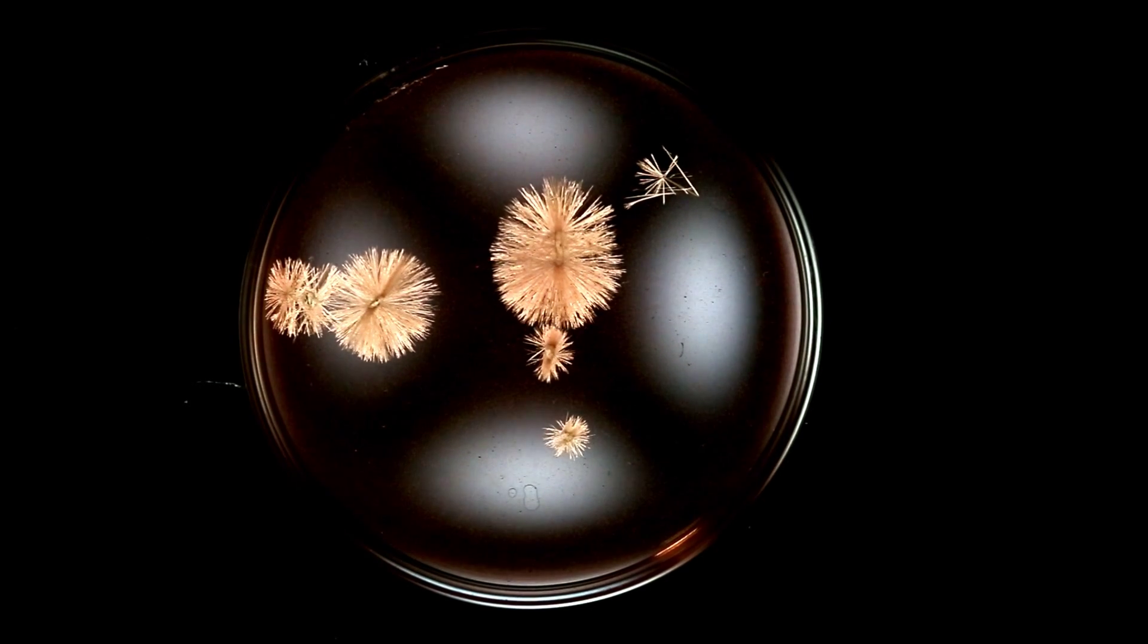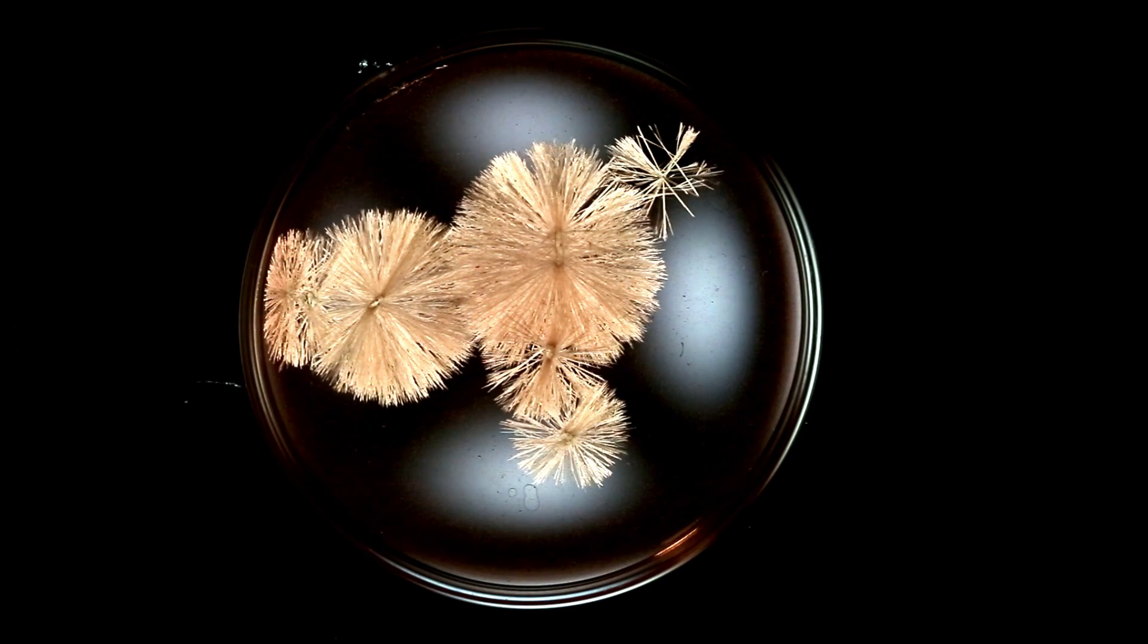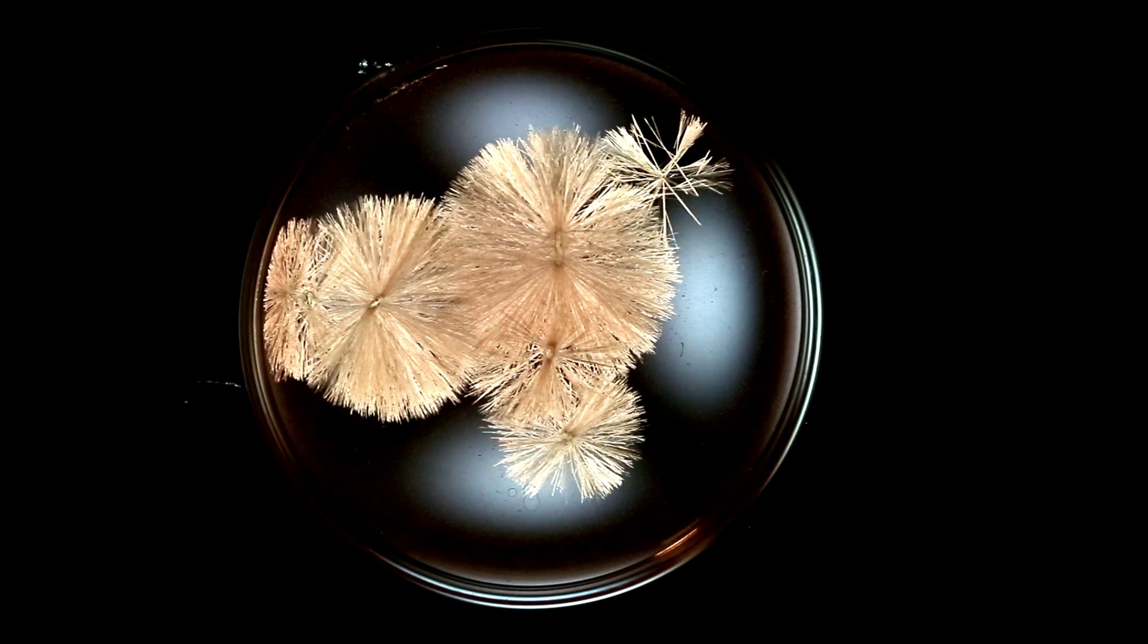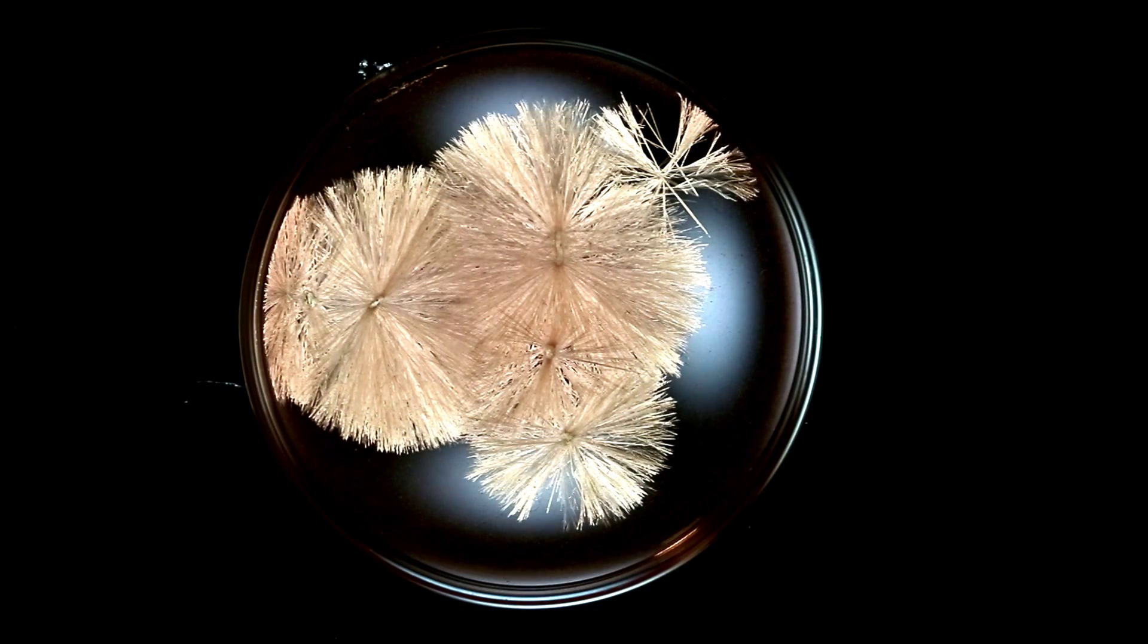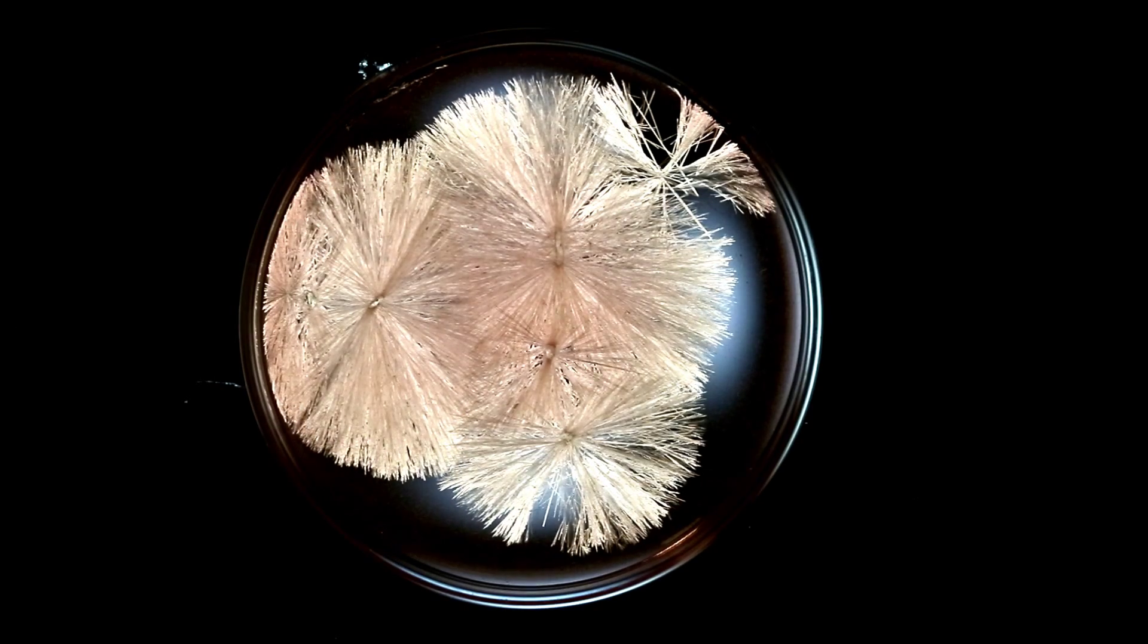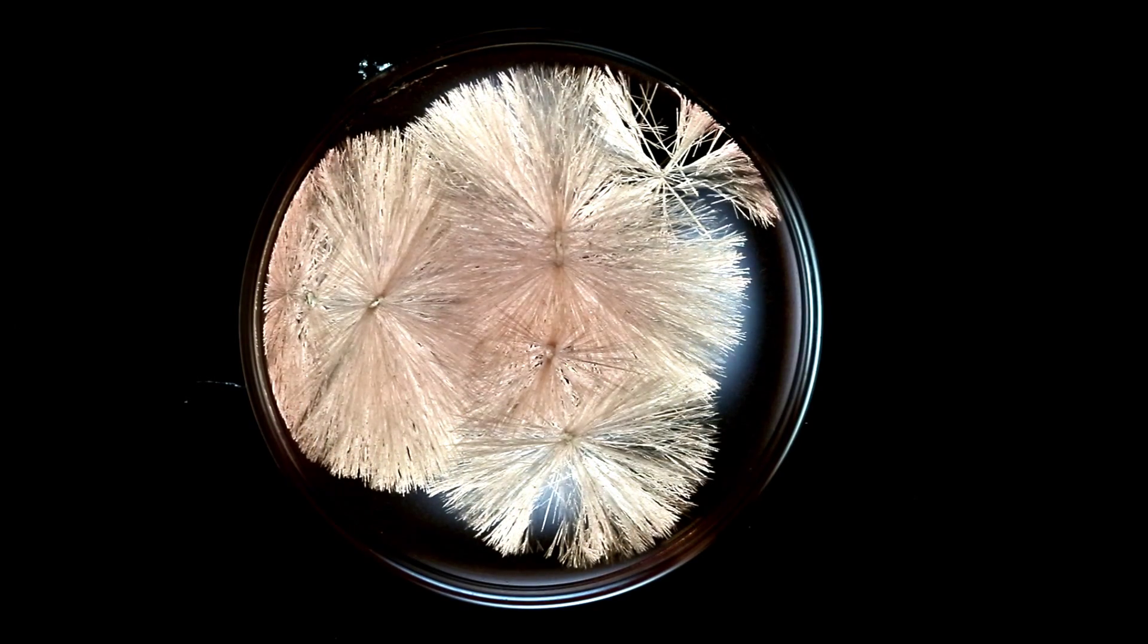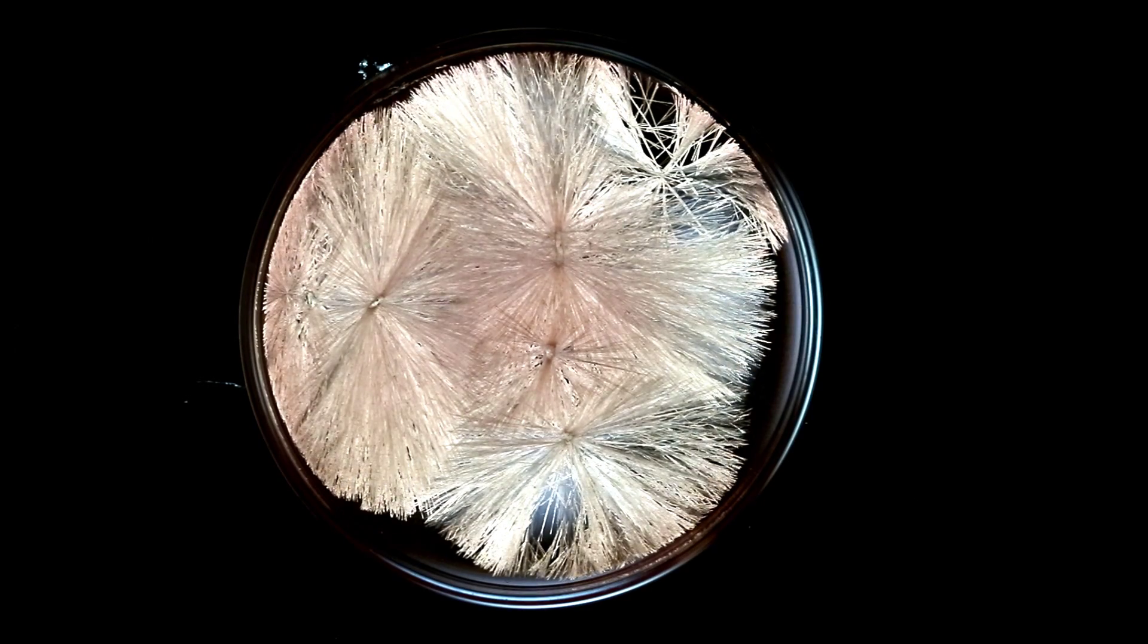Food color can be added to the growing solution to create what looks like colored crystals. The crystals are still the same white color, but the food coloring deposits on the outside of the crystals to give them a colored look. It can increase the entertainment value of the demonstration.